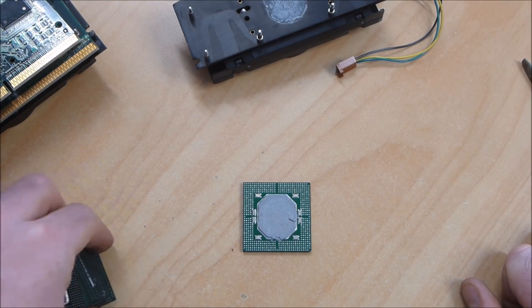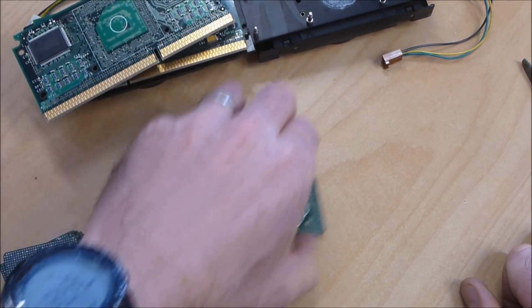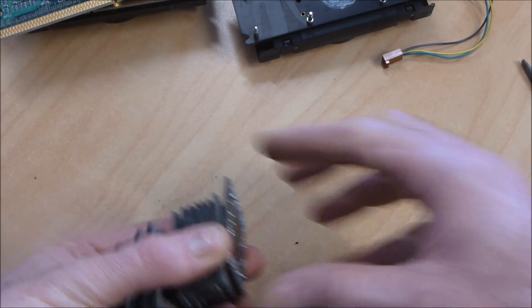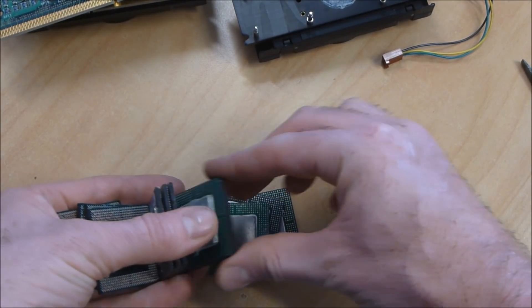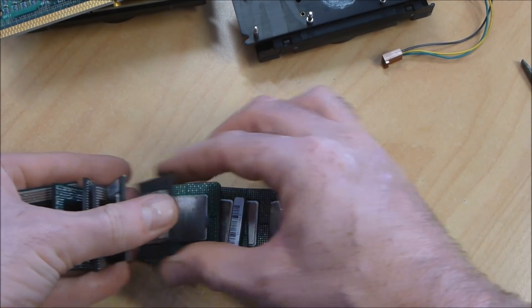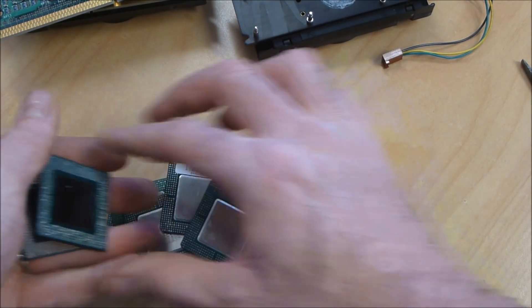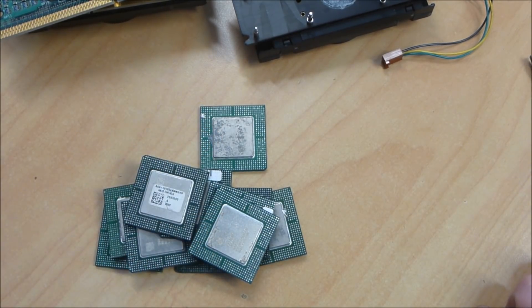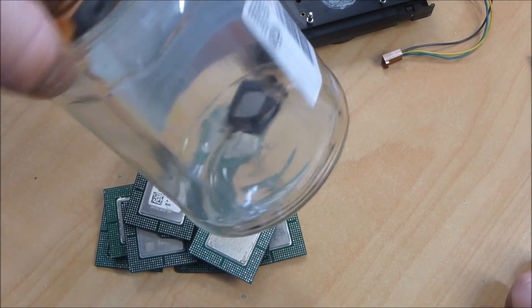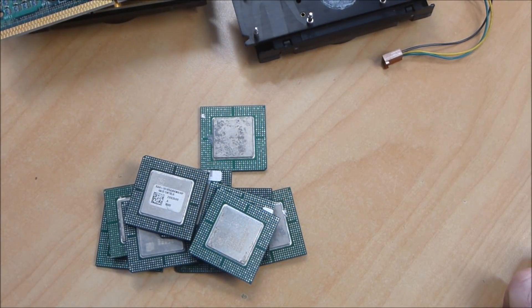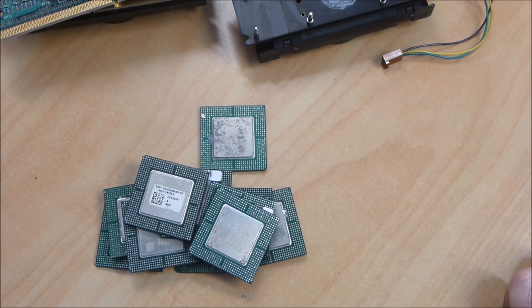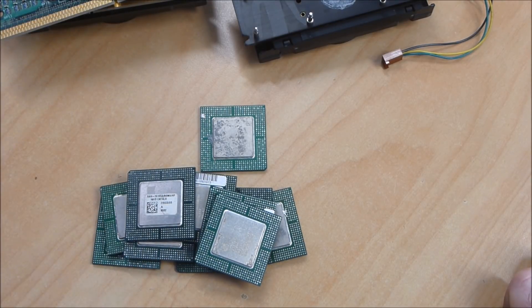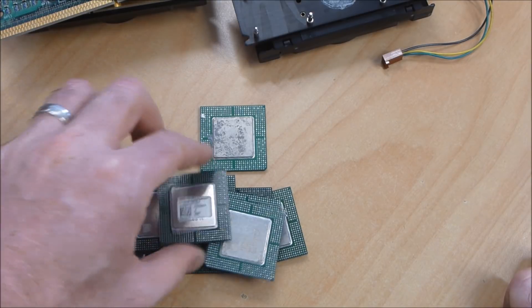So what I'll do next is show you how we're going to pre-prepare these and then we'll get into it. So in total I've got those two there, three four five six seven eight nine ten eleven twelve thirteen fourteen, and here I've got three more that are already prepared, so that's going to be 17 processors in total. Hopefully we get a number big enough that we can actually see what the gold value is.